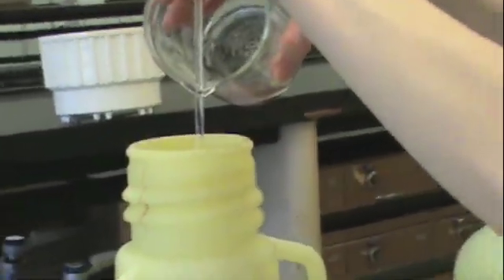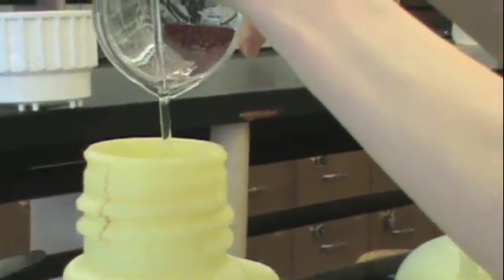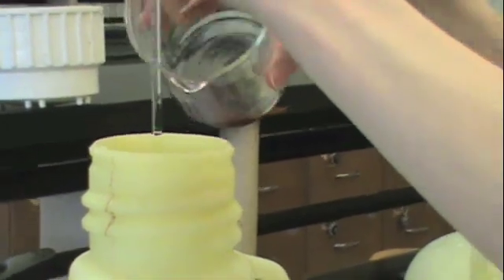Again, be careful that you don't get any precipitate into this bottle. Repeat this step at least once according to your instructor's guidelines.